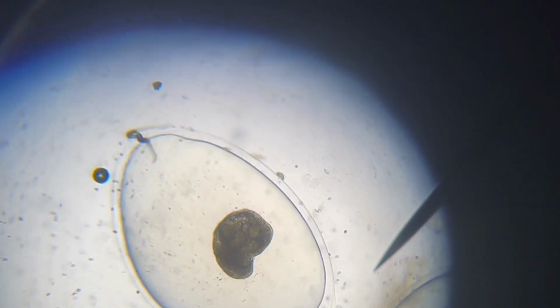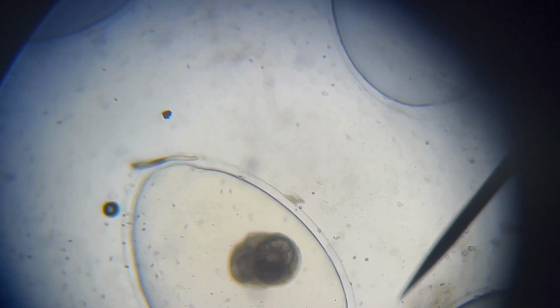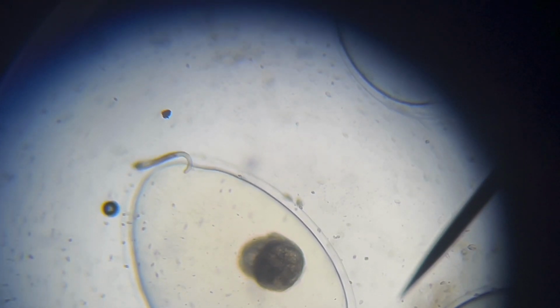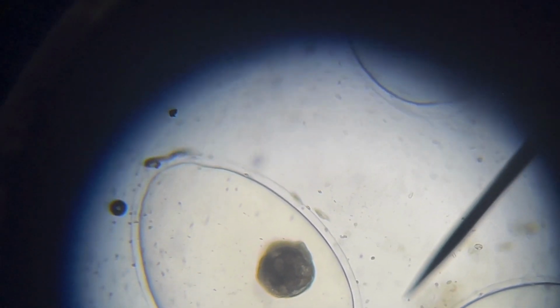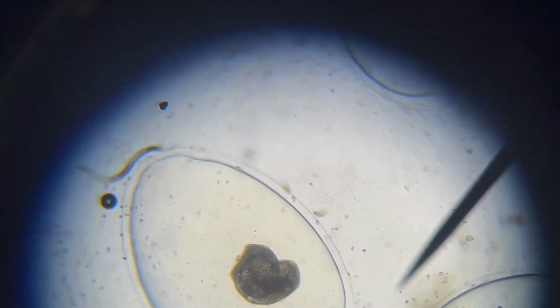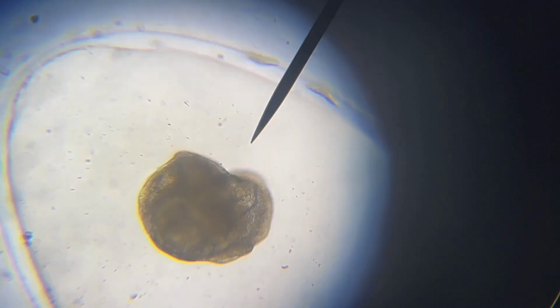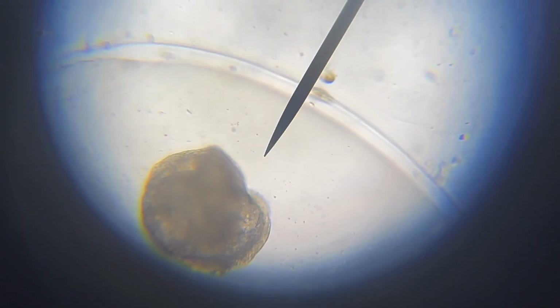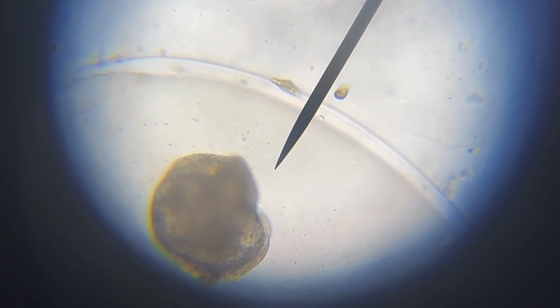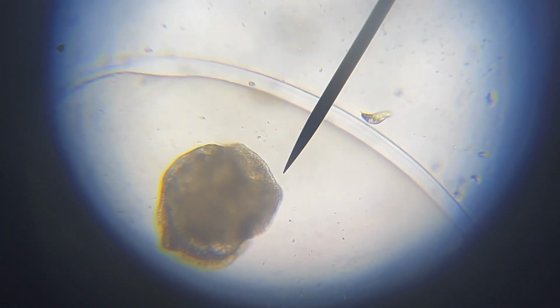I also noticed a few other tiny particles. What could they be? Let's magnify a little bit. Oh wow, they look like some other types of worm or single-celled organism. There are 2 to 3 of them swimming around the snail egg. After doing some more search in Google, they looked like planarian flatworm, but I could be wrong.